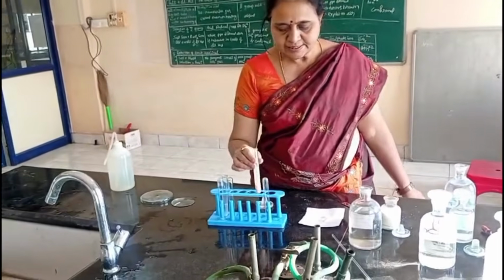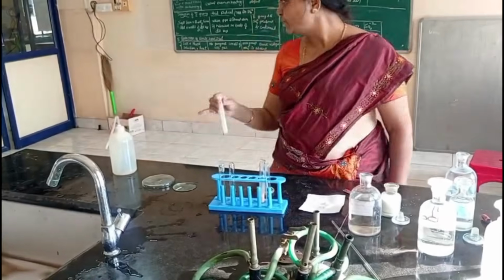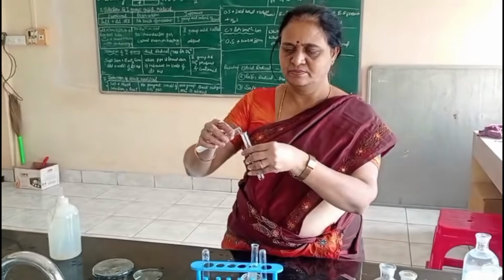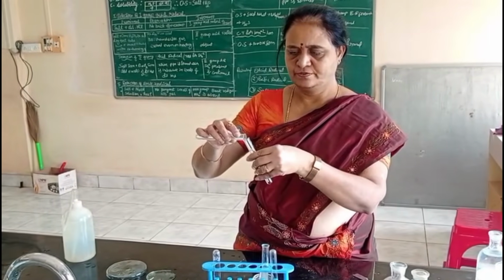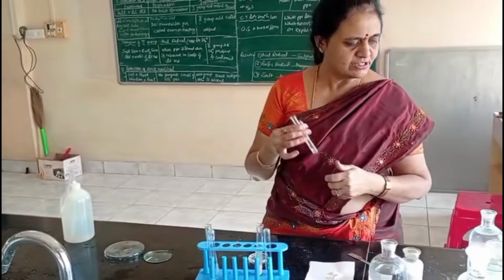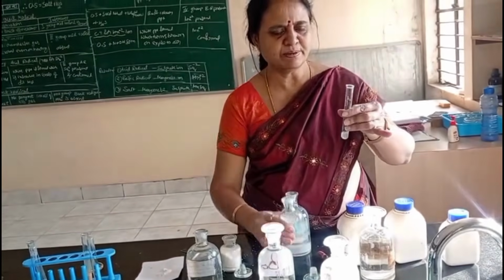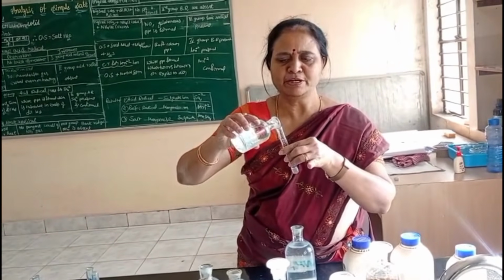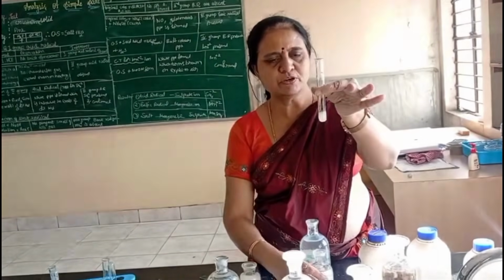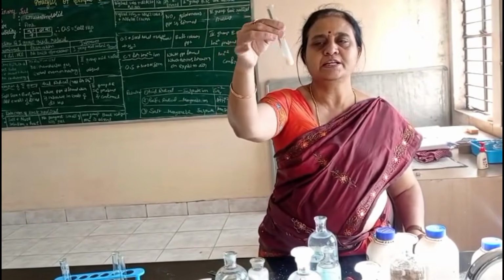Now I am doing CT, confirmative test for fourth group basic radical Mn2+. For this, I am taking original solution. For this original solution, I am adding NaOH. Original solution plus NaOH. I am doing CT for Mn2+ ion. So observe what happens. I am getting a precipitate which turns brown when exposed to air.